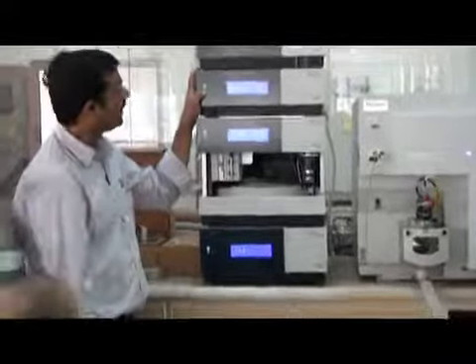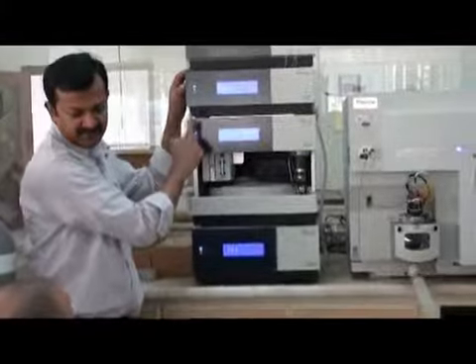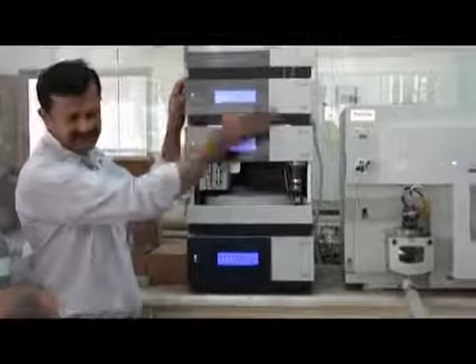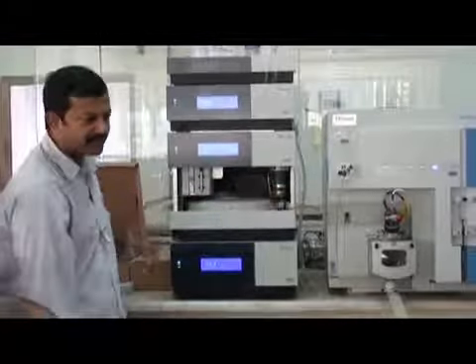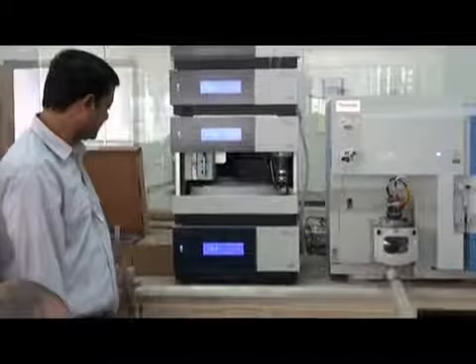Status light. And connected: if this machine is connected to the software, the light will be on. If not connected to the software, the light will not be on. So you can see from here whether it's connected or not. If it is connected, then you can operate from there. Okay, simple. All like this.